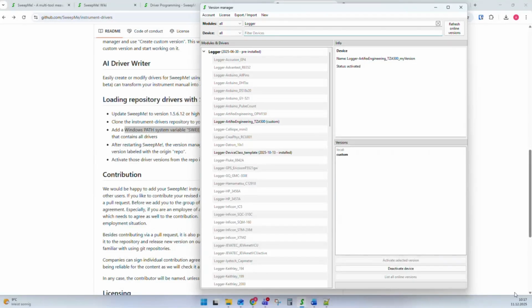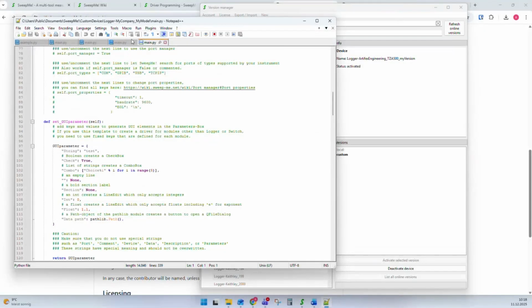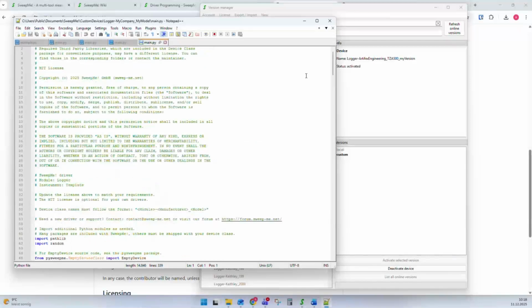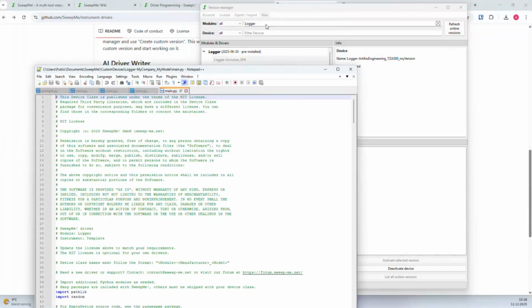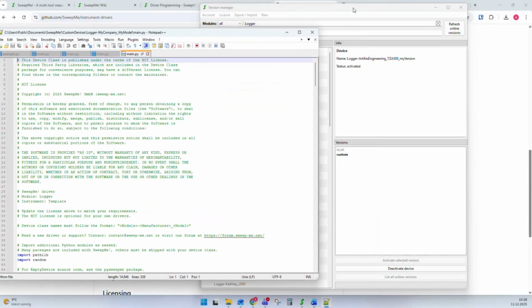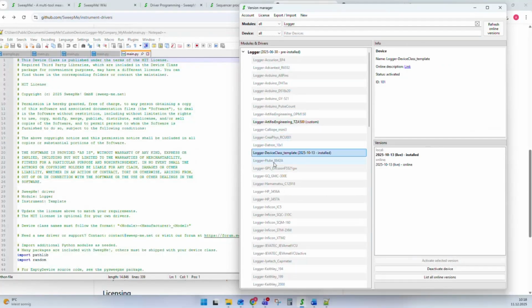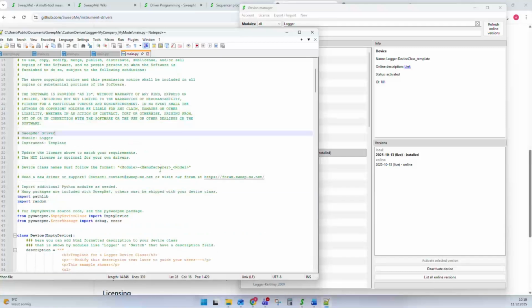Okay, now let's go really into the driver structure. I have now opened this driver logger, my company, my model. This was the driver that I created as a completely new driver using this new button, where I now use the template of SweepMe, the template driver. This template driver can also be found as a normal driver, as a logger driver. You can just download it. If you have a look into it, it will have exactly this code. And this is the template.